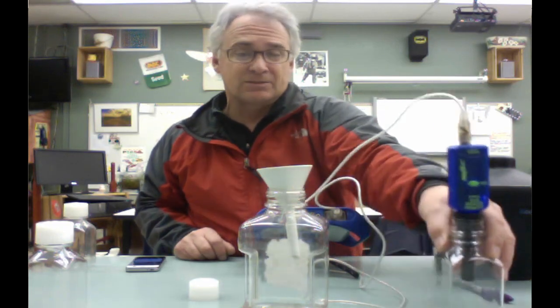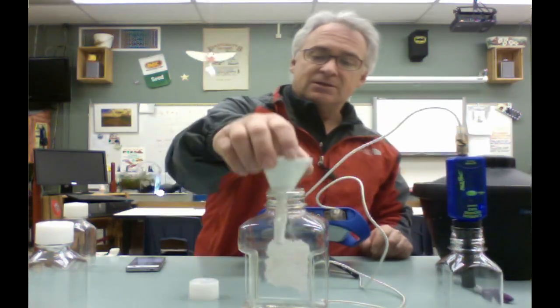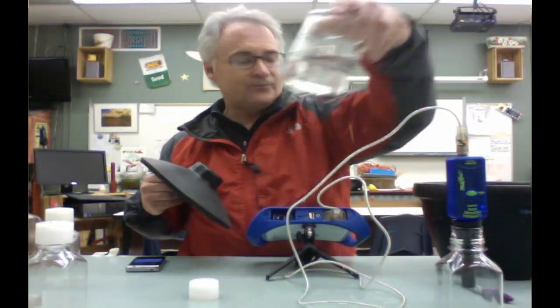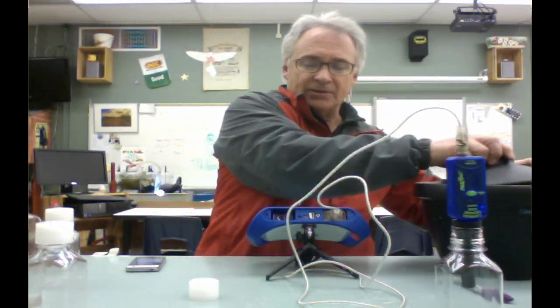Now remember, you're letting the dormant dry seeds stay in this bottle, this collection bottle, and you're going to be sampling the amount of CO2 it produces for the next, right now, about 9 minutes. While that drains off, let's head off to the side. And then the last one is going to be, of course, the one from the ice water. Oh, there you go. I'll put that in there. Always good to have a few washcloths around as well.